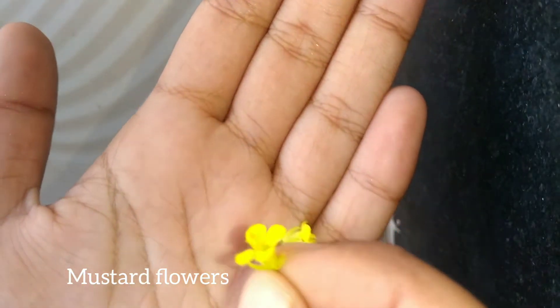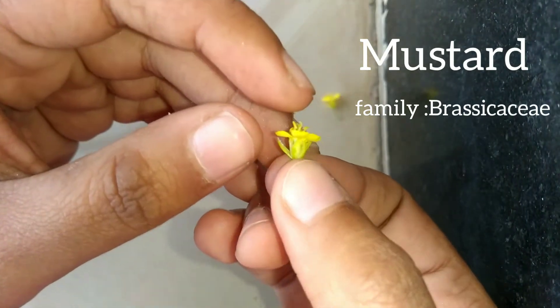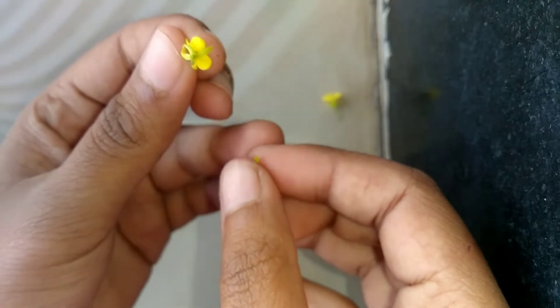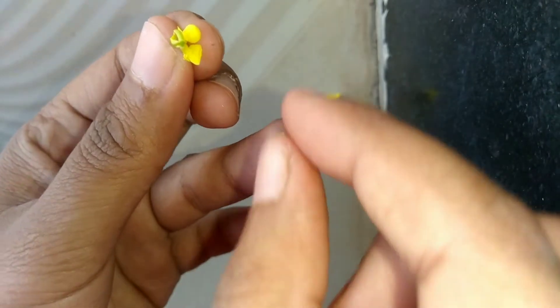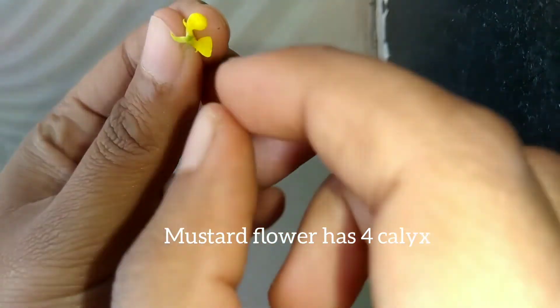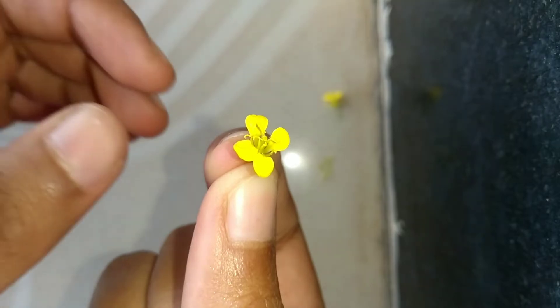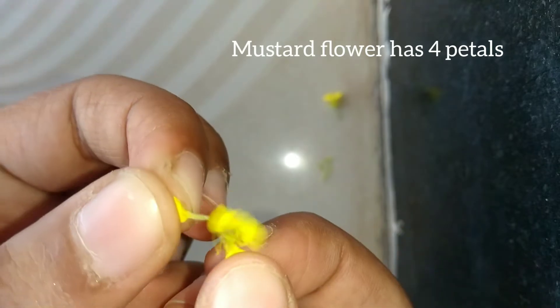These yellow tiny flowers are of the mustard plant. Let's dissect the flower. The mustard flower has four calyx. As you can see, the flower also has four petals, that is four corolla.